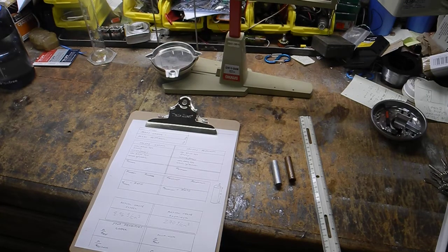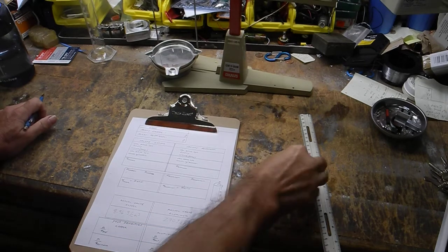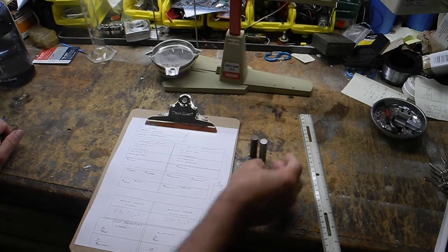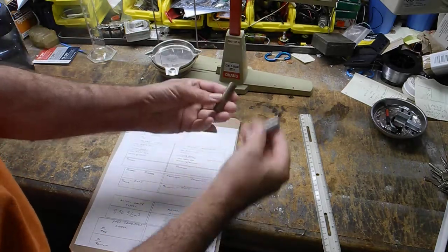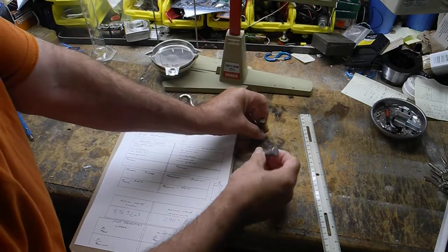Hey everybody, we are doing the density lab. In this lab we're going to find the density of a hunk of copper and a hunk of aluminum. Notice they're pretty much the same size. The thing that's missing for you is to feel the difference. This thing is really light. If you've ever picked up an aluminum can, you'll know the difference, and this thing's pretty heavy, right?